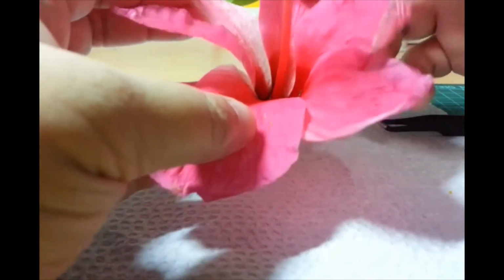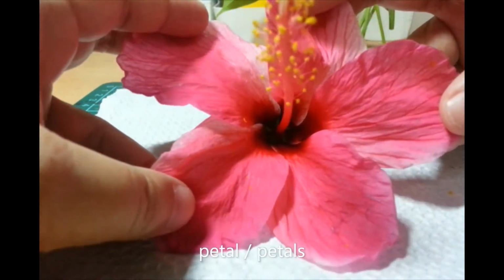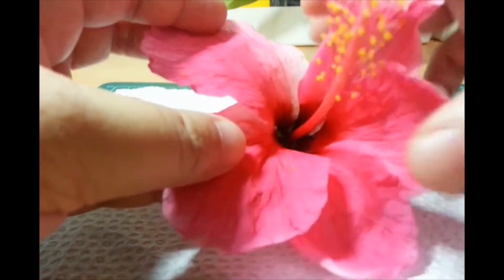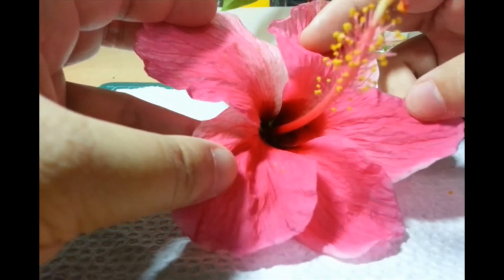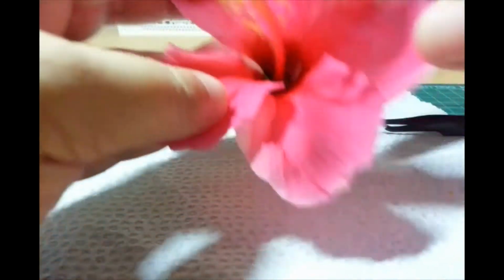So now, we go inward. We now look at the petals. Notice that they're also arranged in a ring. Like I said, these are brightly colored because Gumamela is a day-blooming plant. Also, at the base of it, it produces nectar.